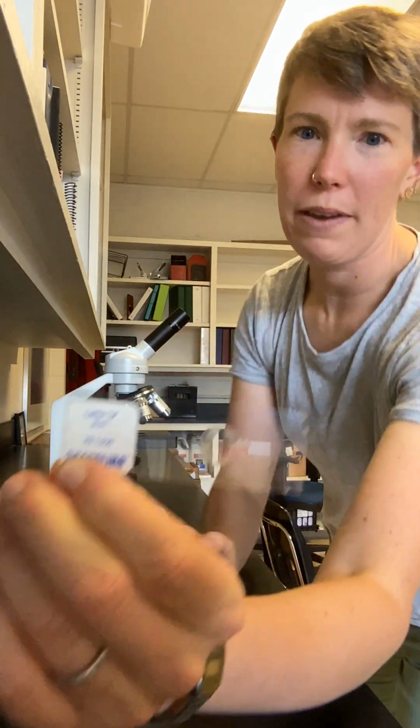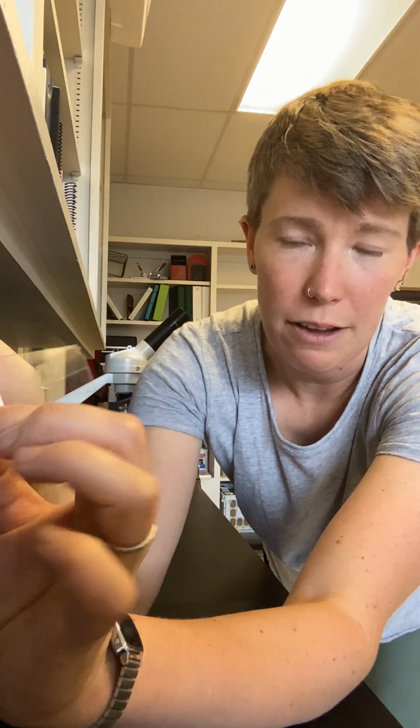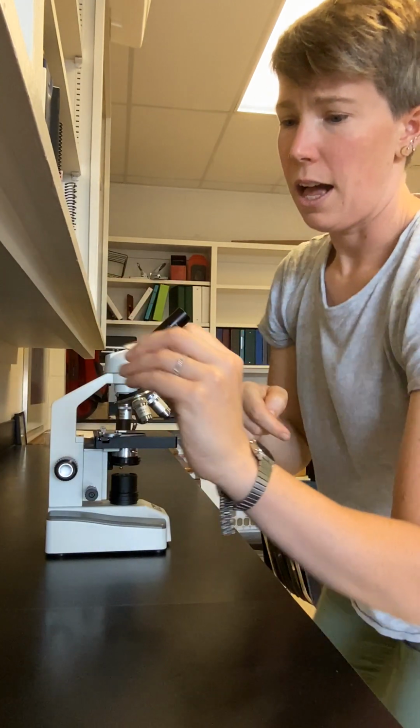So we're going to start out, we've got a sample, the letter E. This is the first thing that you're going to look at when we start to use the microscopes. Notice it's got a descriptive title off to the left of the slide here, and then it's got the sample right in the middle here.